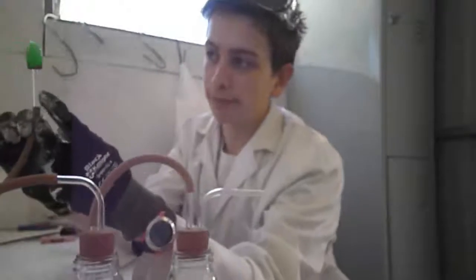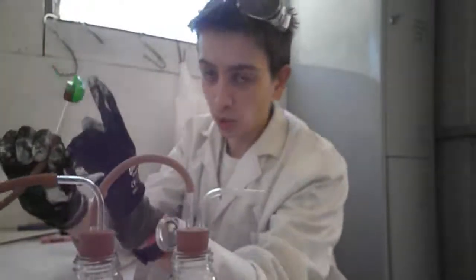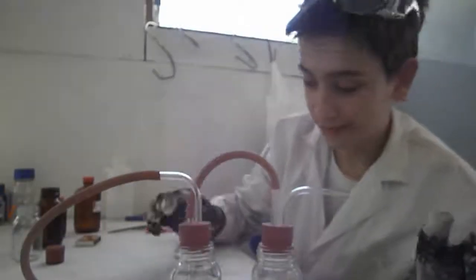Okay, so finally completed it after an addition of safety stuff. I have connected a little glass pipe with a stopper onto a water balloon, so hopefully there's enough pressure for that to work. Other than that, apparently I've just got to blow into there and it'll travel through and start the reaction. Hopefully I don't die. So, okay, let's go.